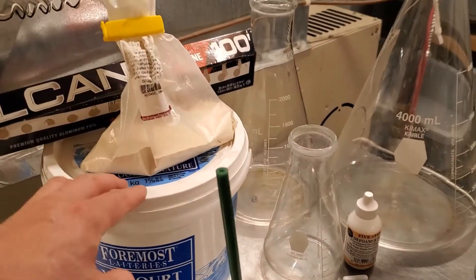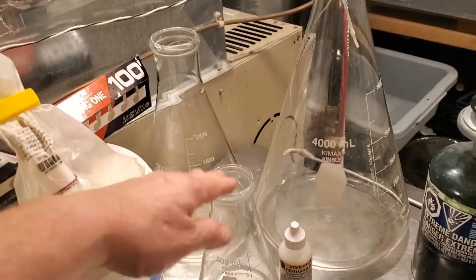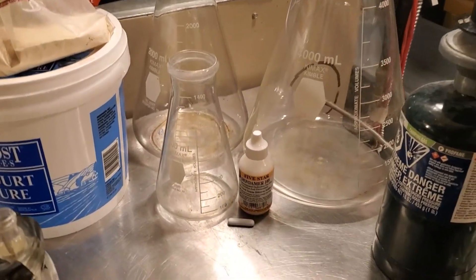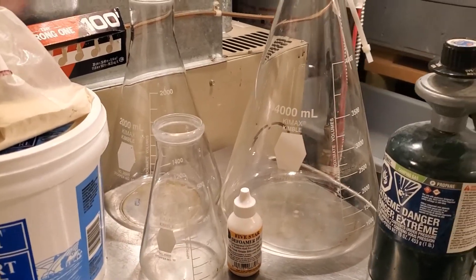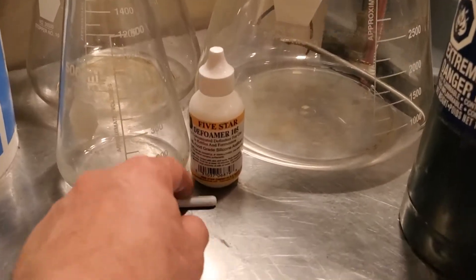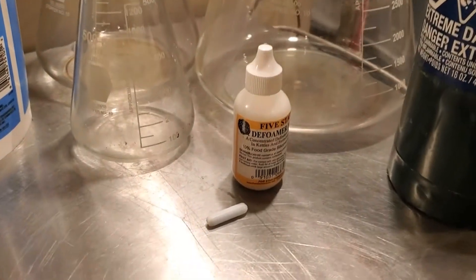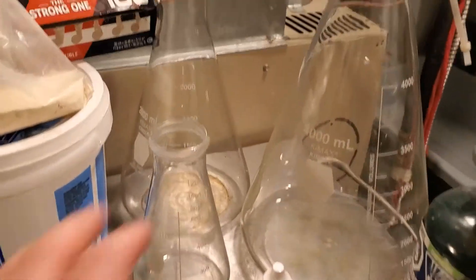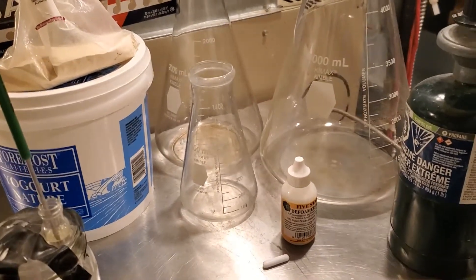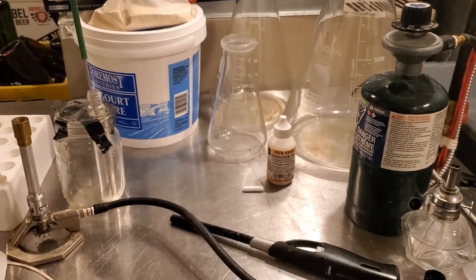After I move on from the initial growth in the starter vial, I'm going to need dried malt extract — I've got some in this tub here. I also have some yeast nutrient, aluminum foil that goes on these borosilicate Erlenmeyer flasks, and I have three flasks: a 500ml, a 2000ml, and a 4000ml. I also have a stir bar that will be used on a stir plate in the incubator, and some defoamer solution so that when I boil the wort for the next steps it doesn't boil over on my stovetop.